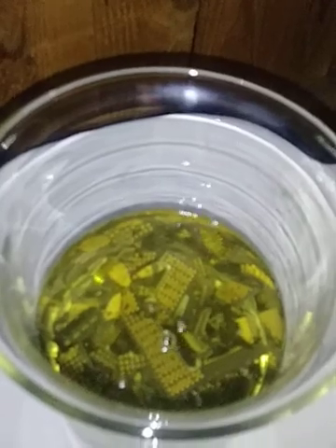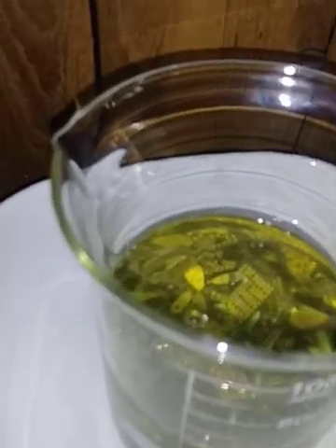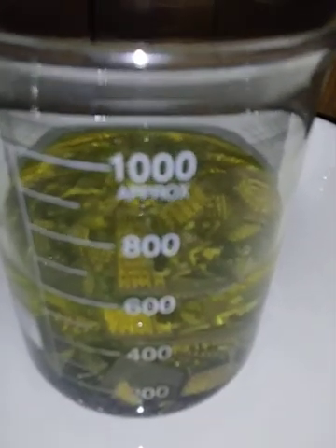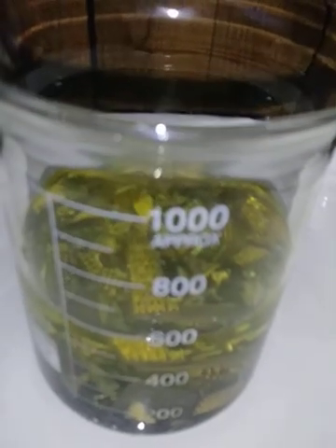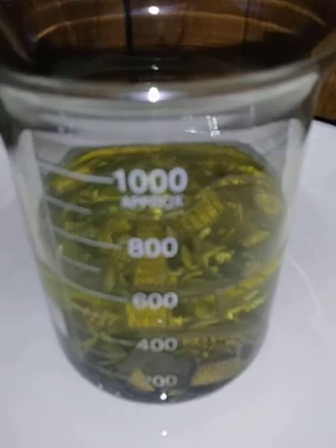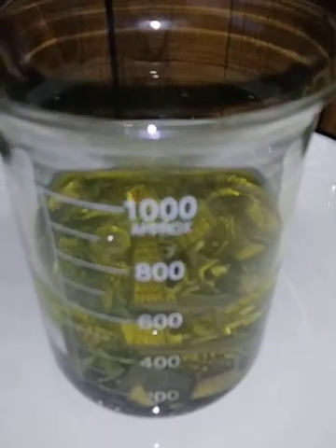Put about 600 milliliters of hydrochloric acid into the beaker with the CPUs. There's definitely some tungsten underneath the pins and pads that causes a pasty yellow-green residue in your solution when you cook this. I'm going to do it with aqua regia throughout the whole thing. There are also magnetic pins in here that will need to be fully dissolved before this process will be good.